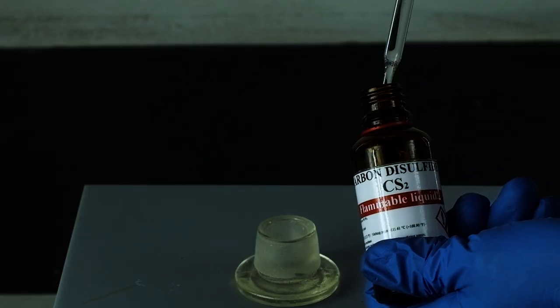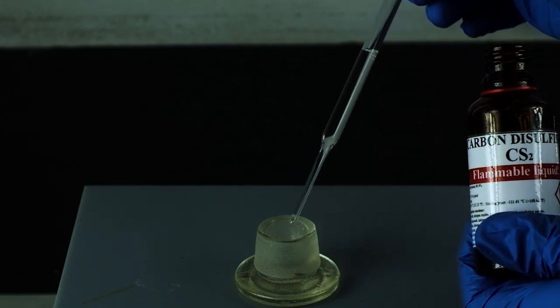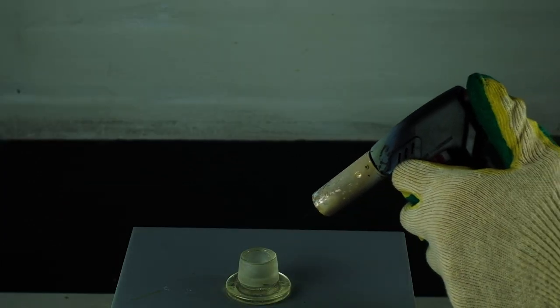So let's start. The reaction of carbon disulfide with dinitrogen monoxide is a classic barking dog reaction. But now I will show you how carbon disulfide will react with solid nitrous oxide.